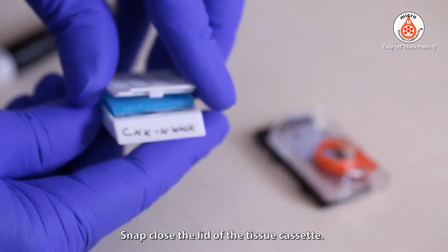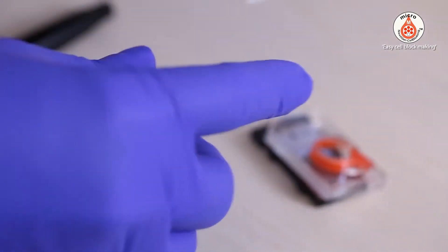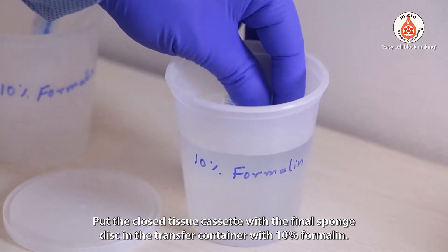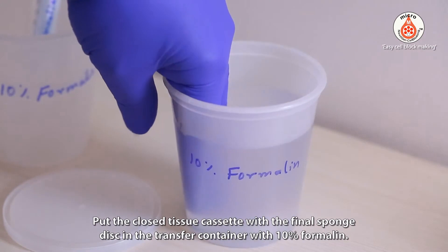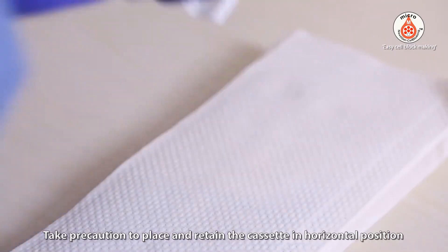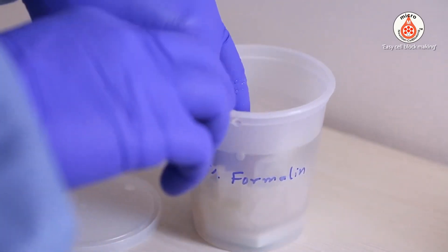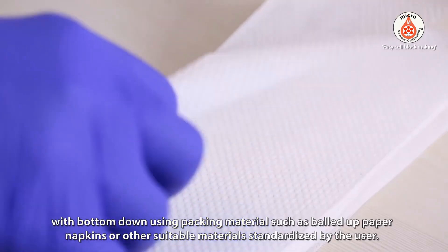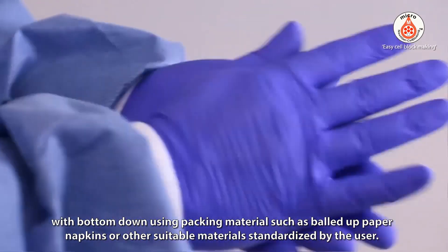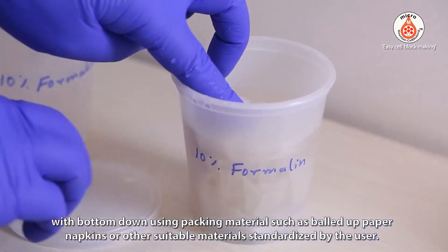Snap close the lid of the tissue cassette. Put the closed tissue cassette with the final sponge disk in the transfer container with 10% formalin. Take precaution to place and retain the cassette in a horizontal position with the bottom down, using packing material such as balled-up paper napkins or other suitable materials standardized by the user.